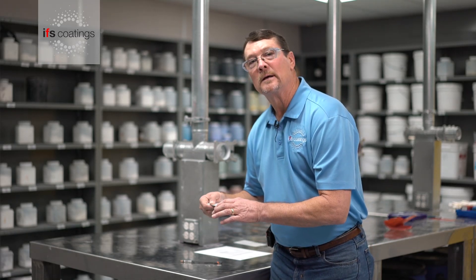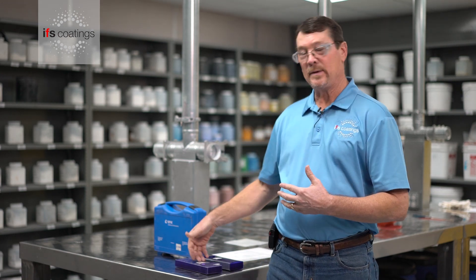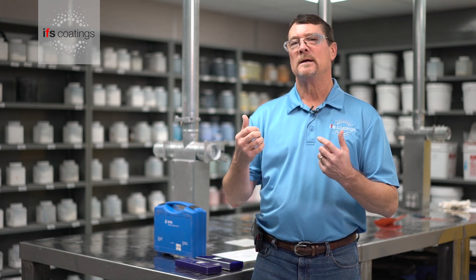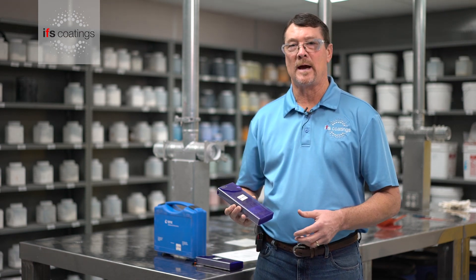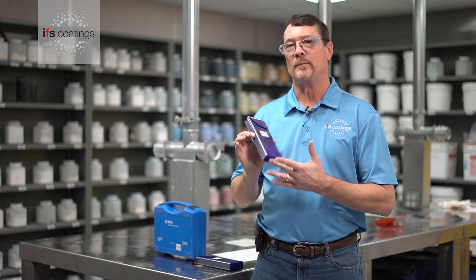This would be considered at least an H pencil hardness for this application. Having good pencils from a quality supplier — such as BYK or the brand Turquoise — is important. You want to be consistent with your pencils and make sure you're using a high-quality supplier, because it can affect how you perform this test. BYK is one supplier; there are several others, but just be consistent with the pencils you use.